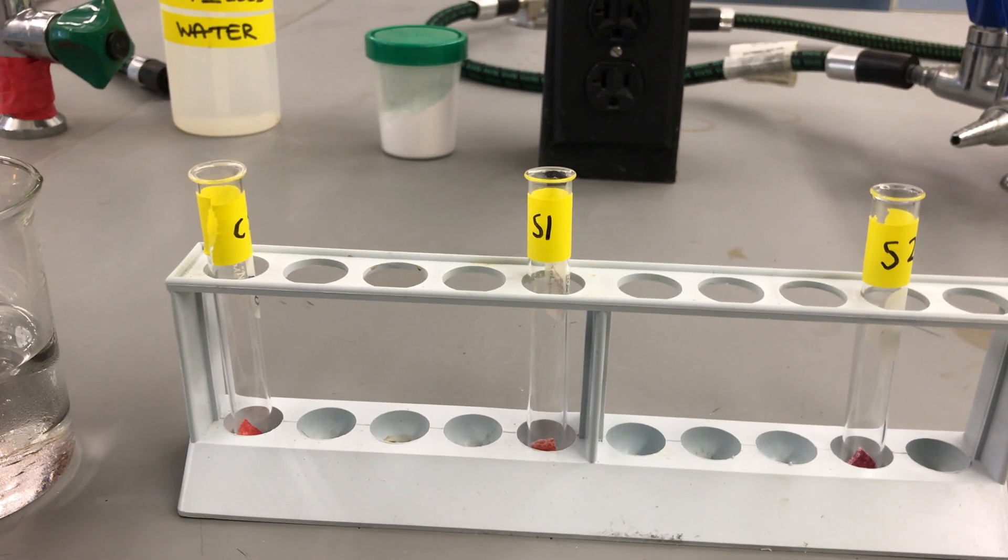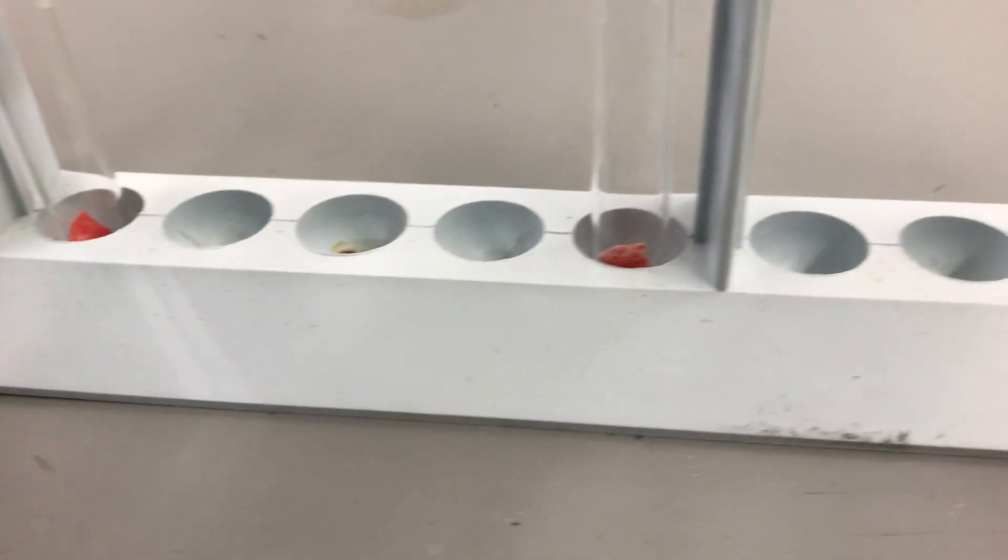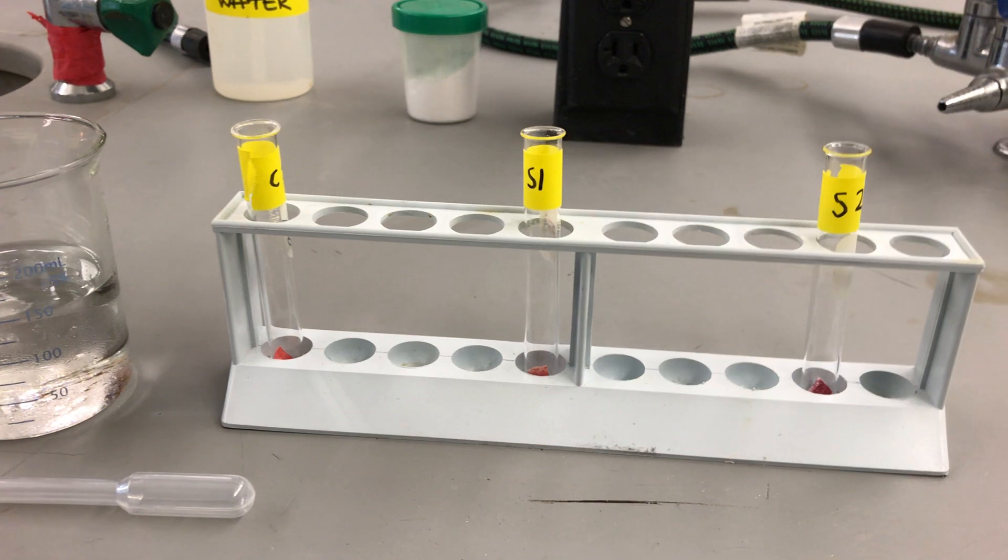All right, ladies and gents, now that we've cut out pieces of our lipstick stains and added them to the test tubes, which you can see here, it's time to add our lipstick solvent.